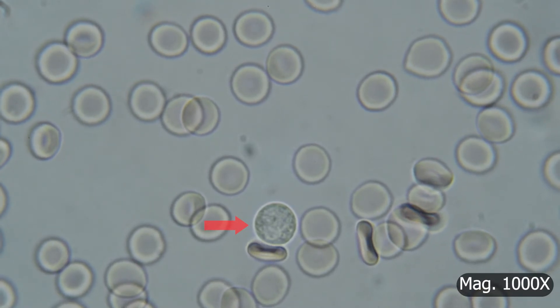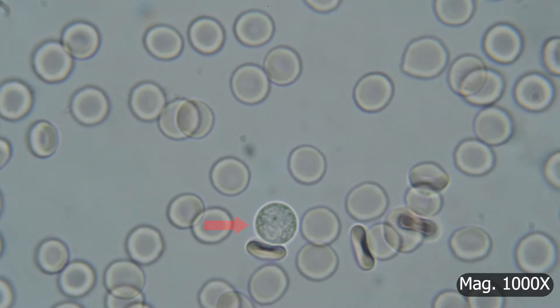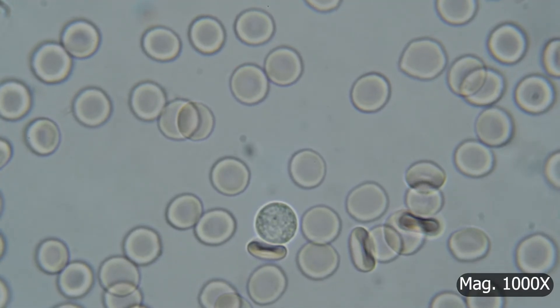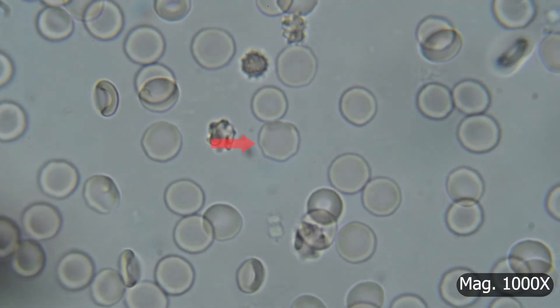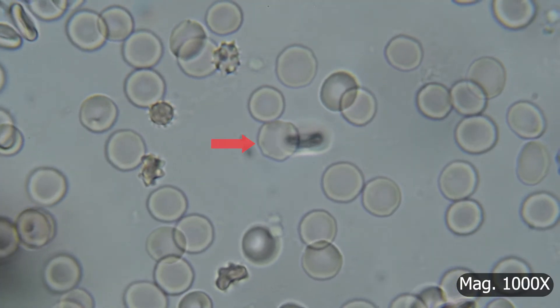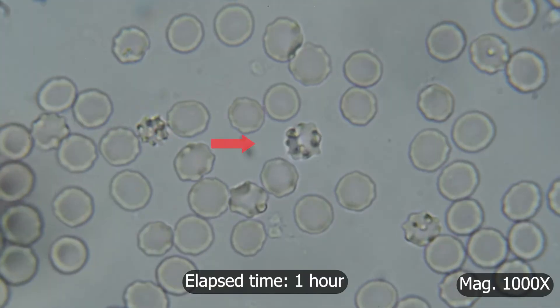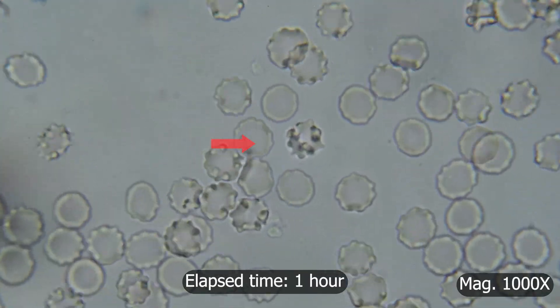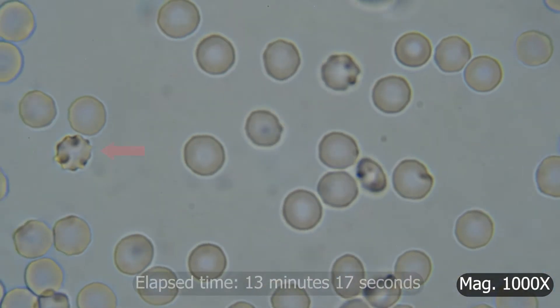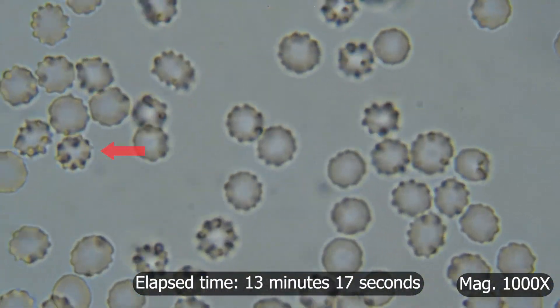The same thing happens when these cells are placed in a concentrated salt water solution. When the footage is sped up, the cell can be seen shrinking and changing shape as it loses water. Red blood cells end up having a spiky appearance. This process is known as crenation.